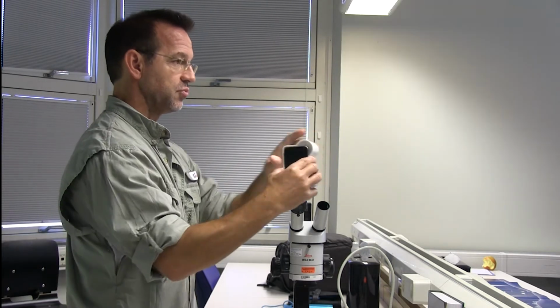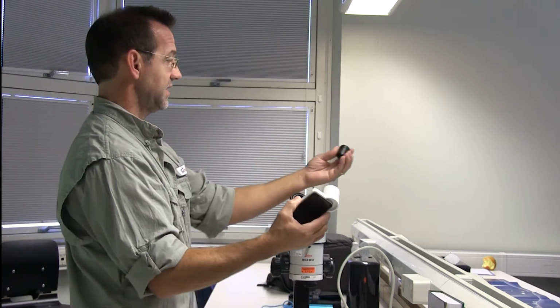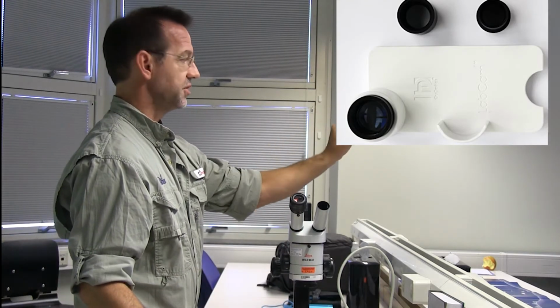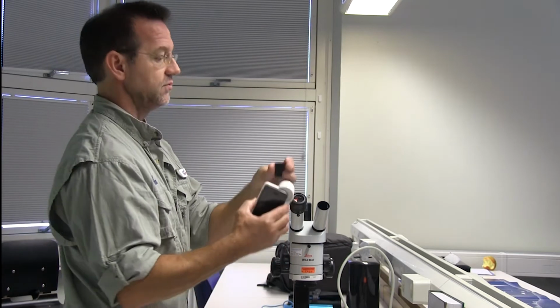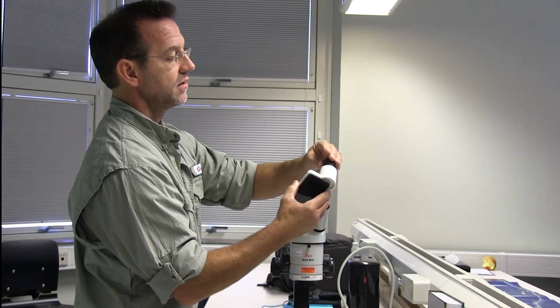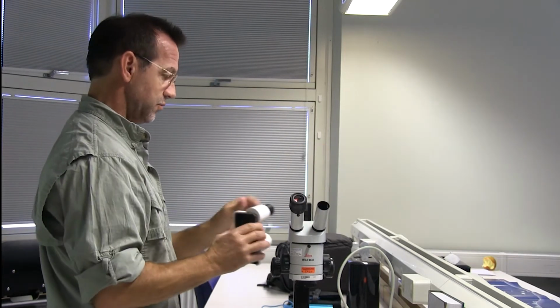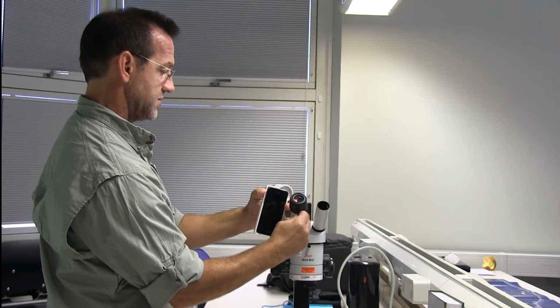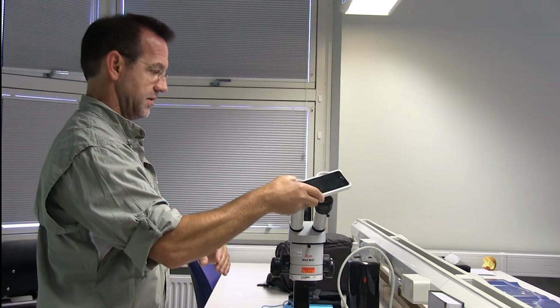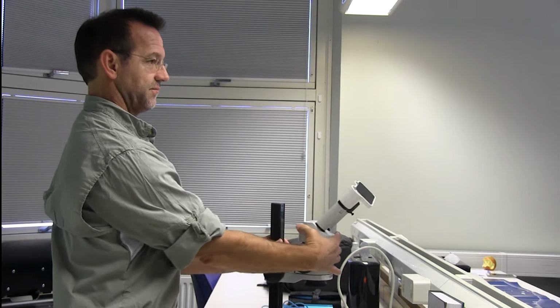And then it's the same principle. How do we get connected to the microscope? Same technology. He has a 30 millimeter adapter or a 23 millimeter adapter. You would just thread this in to here, and then it slides into the microscope eyepiece, but you would want to remove this eyepiece and have it around on this side because there's nothing over here. And then your image comes up on the screen right here.